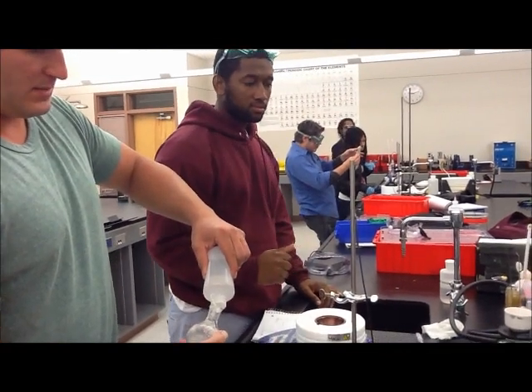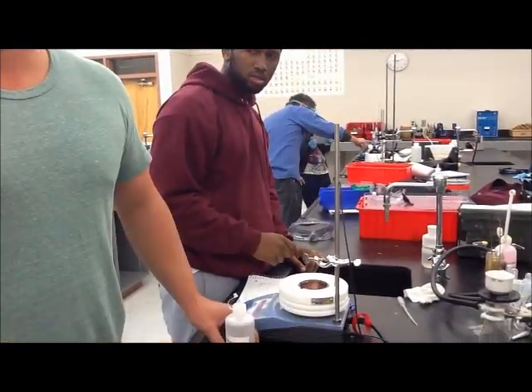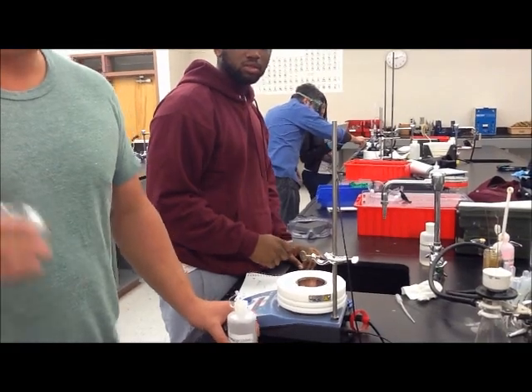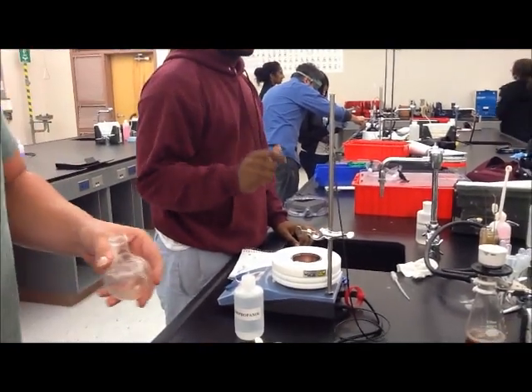Wash it with water probably, rather than isopropanol. I would add water because isopropanol might just dissolve it. We're definitely getting something. That's good.